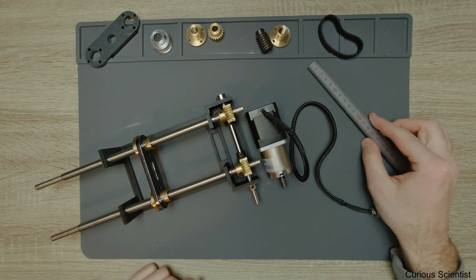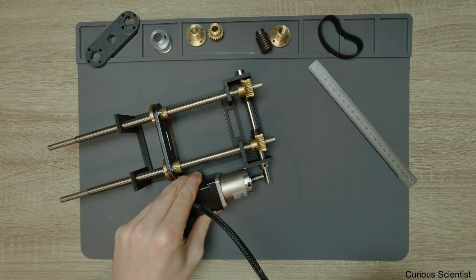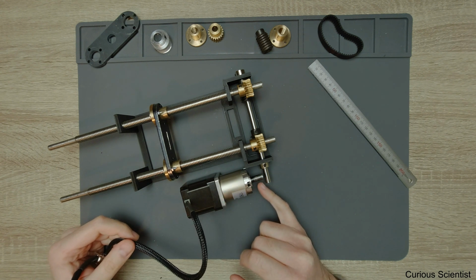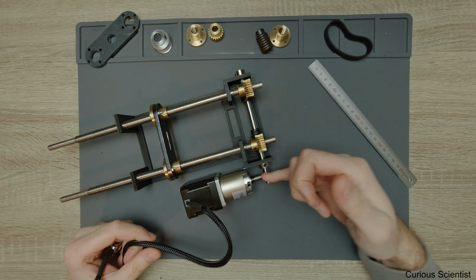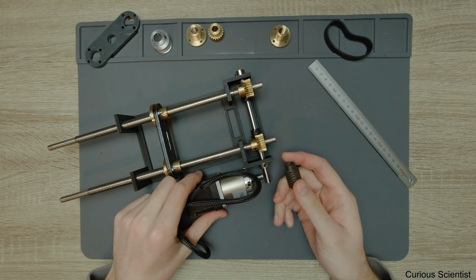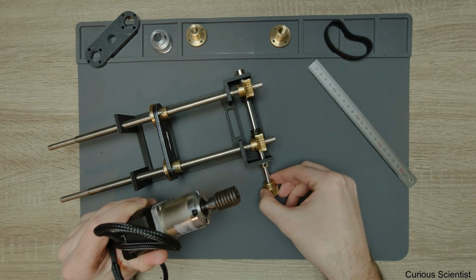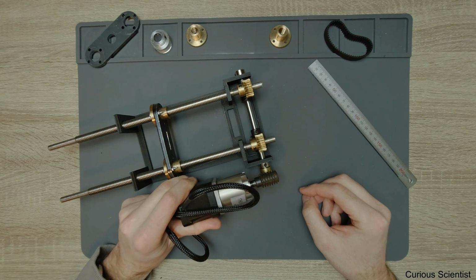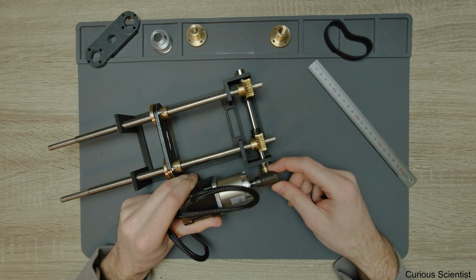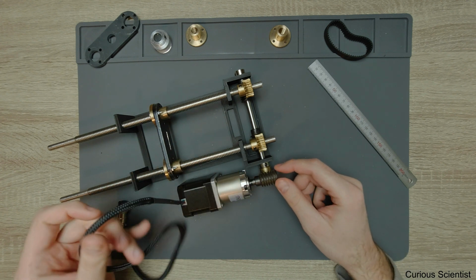And if you don't like the long construction, then this can be modified in such a way that you put it like this, put the motor like this, and instead of using the belt, because now you are perpendicular to the shaft, you can use this kind of worm gear again. So you just basically put the worm gear on the motor shaft and the worm wheel on this shaft and drive it like this. But you have to consider that this is 1 to 20 gear ratio. So you drop your speed by a significant amount, and you increase the torque as well.